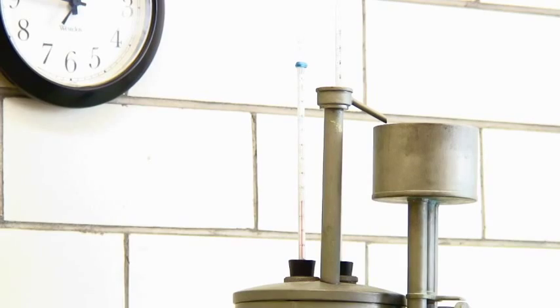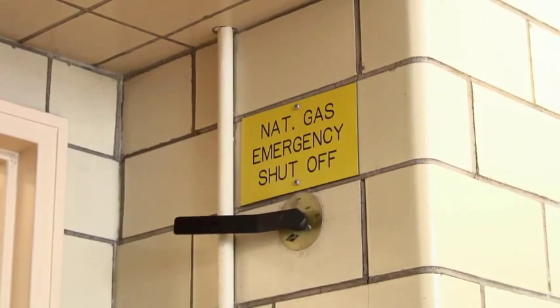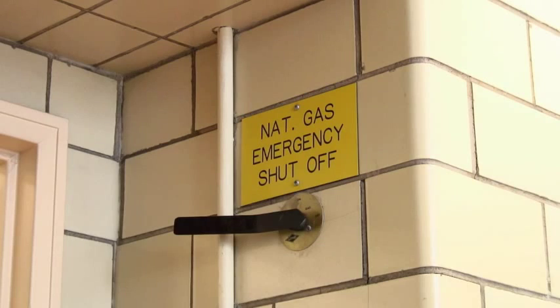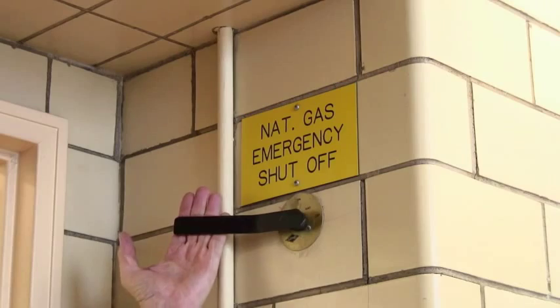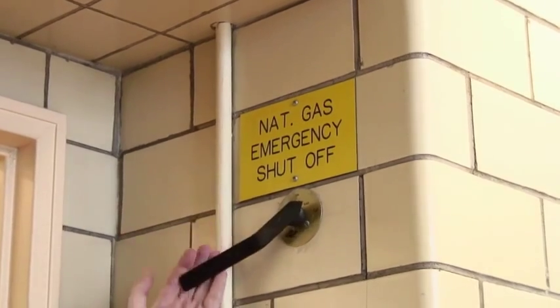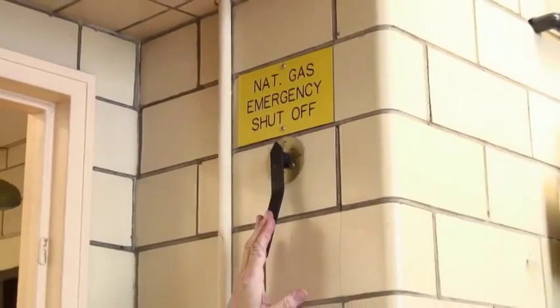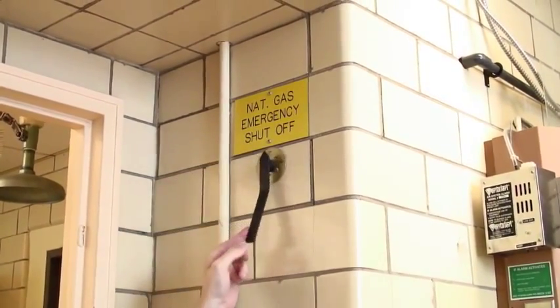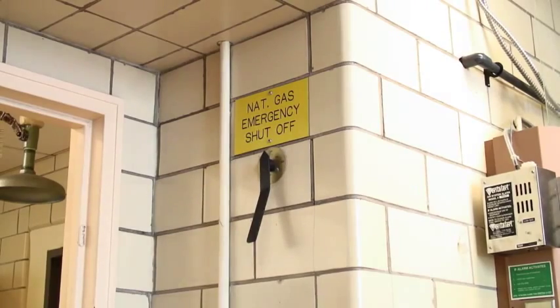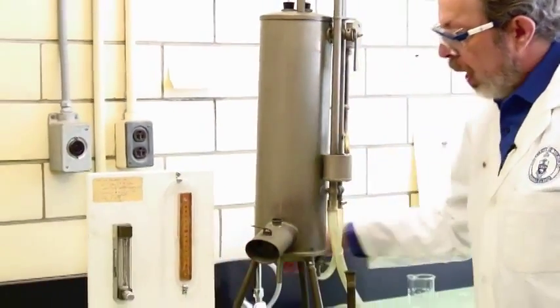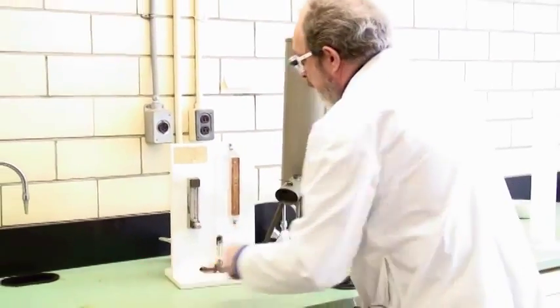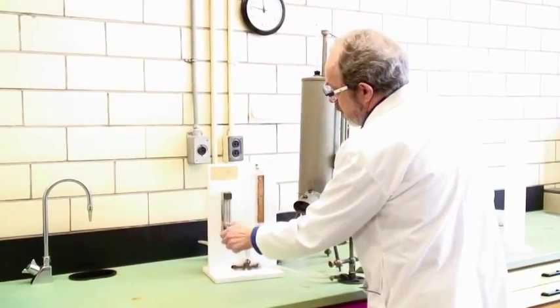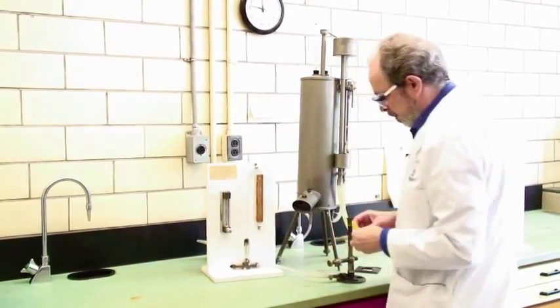Let's try lighting the gas. Wahlberg 208 is one of the very few rooms in the building that actually has natural gas service which is why the instrument is in here. You need to turn the gas actually on to the entire room here using this nozzle. Before you leave make sure that you shut it off again. We'll need to turn it on so that we can use the apparatus. Turn the gas on and have a match ready and then open the rotameter and get about 50% flow.